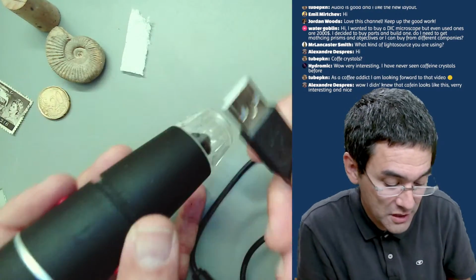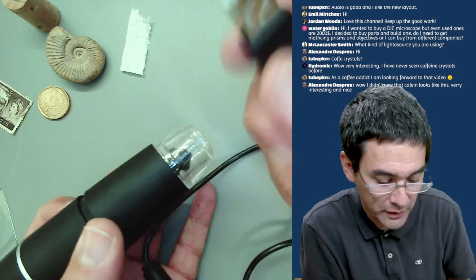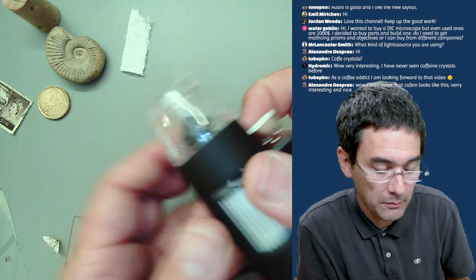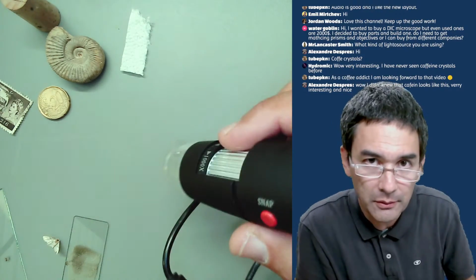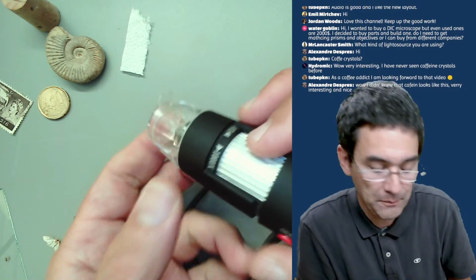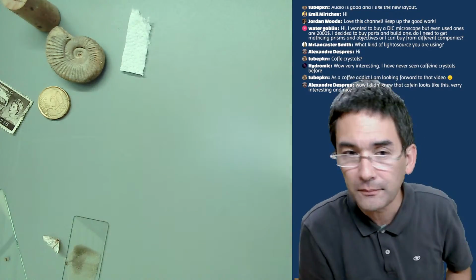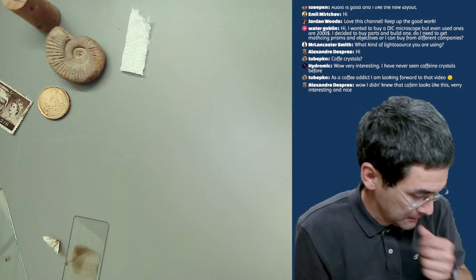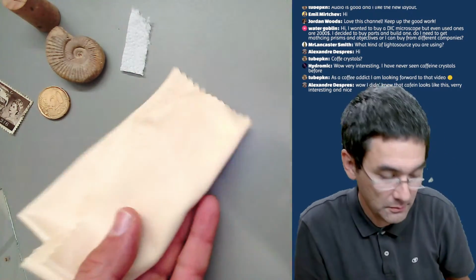On my USB hub here, it didn't connect, so I suppose maybe because I already have too many things connected. But I just wanted to tell you that that's also a way of getting a very similar image. So that's also a possibility. I just want to move on a little bit to show you a few more things. Something that I didn't expect either.